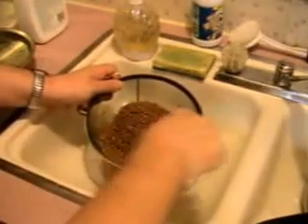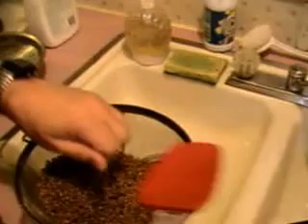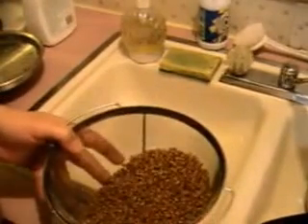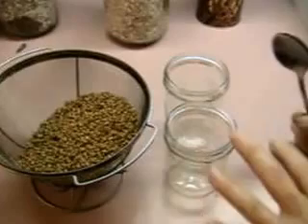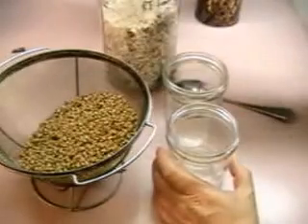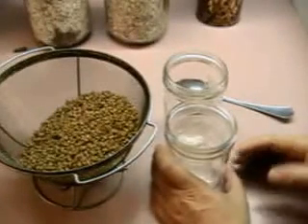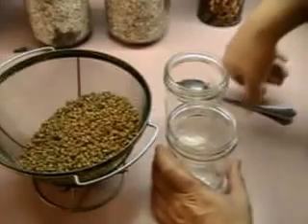Once it's dried off and cooled down adequately — soft and moist but no water left behind when it touches something — that's the ideal state for your grain when you put it in jars. When filling jars, the purpose determines how much you put in. If you're doing a grain-to-grain transfer, fill the jar about two-thirds full. If you're inoculating with spores or liquid mycelium concentrate, fill it about three-quarters full or slightly more.